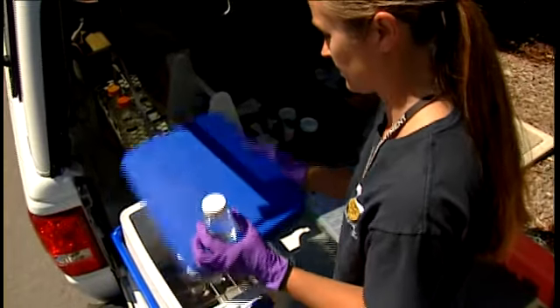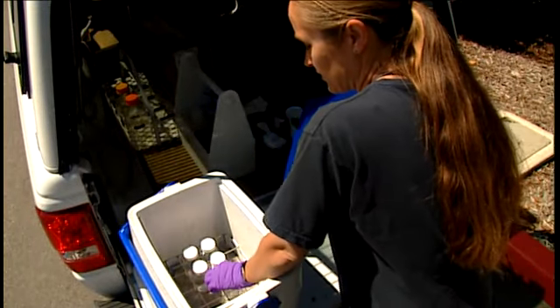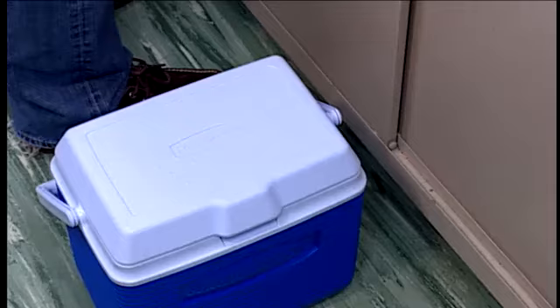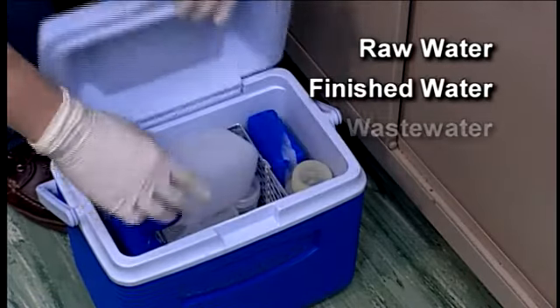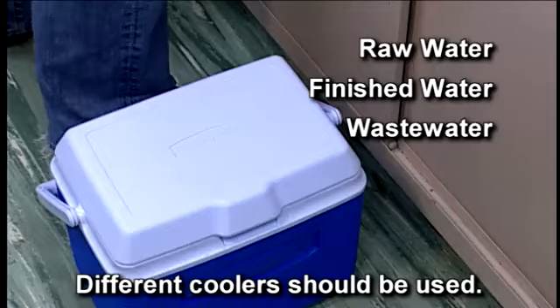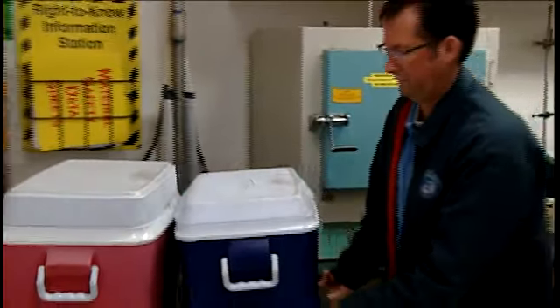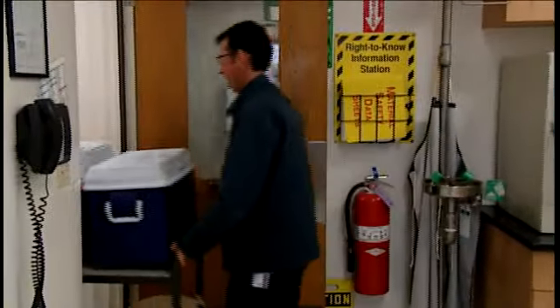Sample bottles should be transported in a cooler or ice chest. If collecting different types of samples such as raw water, finished water, or waste water, different coolers should be used. Coolers used for bacteriological sampling should be cleaned daily.